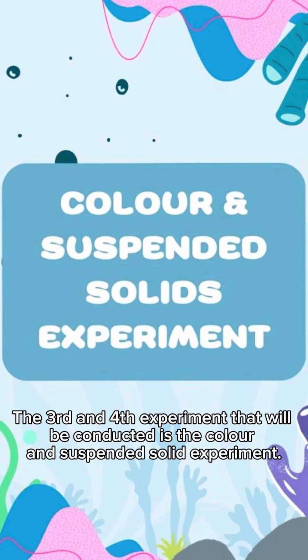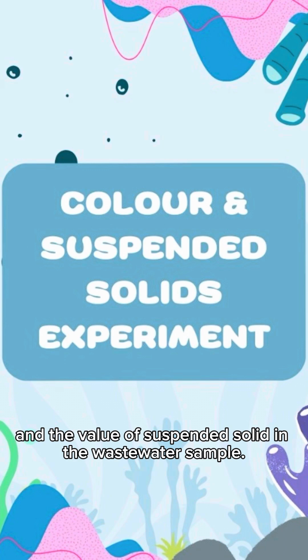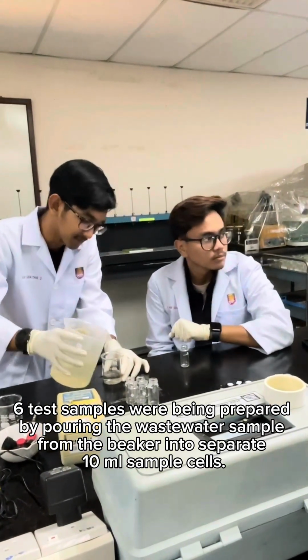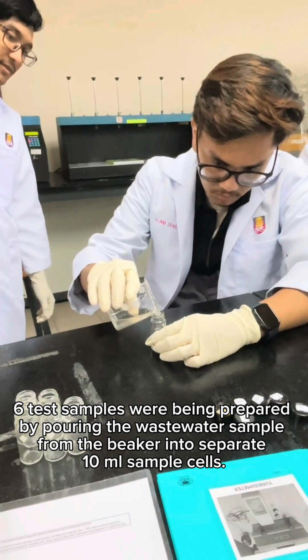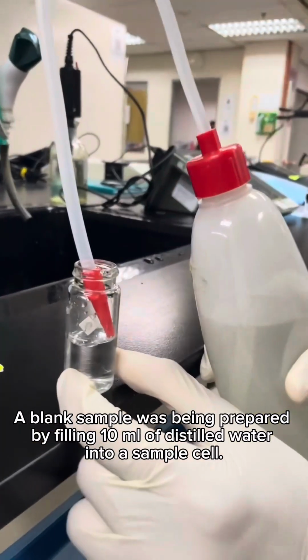The third and fourth experiments that will be conducted are the color and suspended solid experiments. From these two experiments, two values will be obtained, which are the color of the wastewater sample and the value of suspended solid in the wastewater sample. Six test samples were prepared by pouring the wastewater sample from the beakers into separate 10 ml sample cells. A blank sample was prepared by filling 10 ml of distilled water into a sample cell.